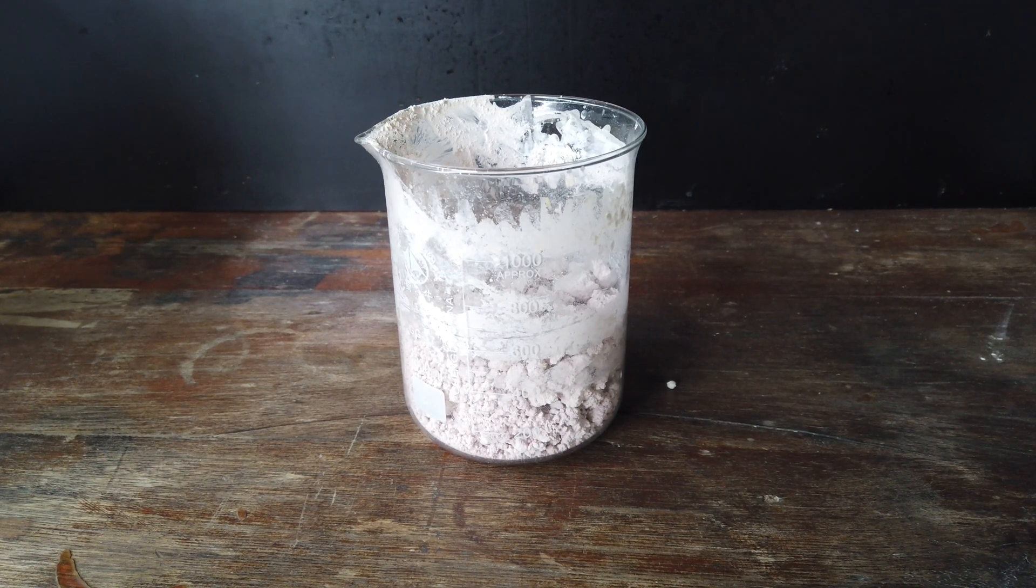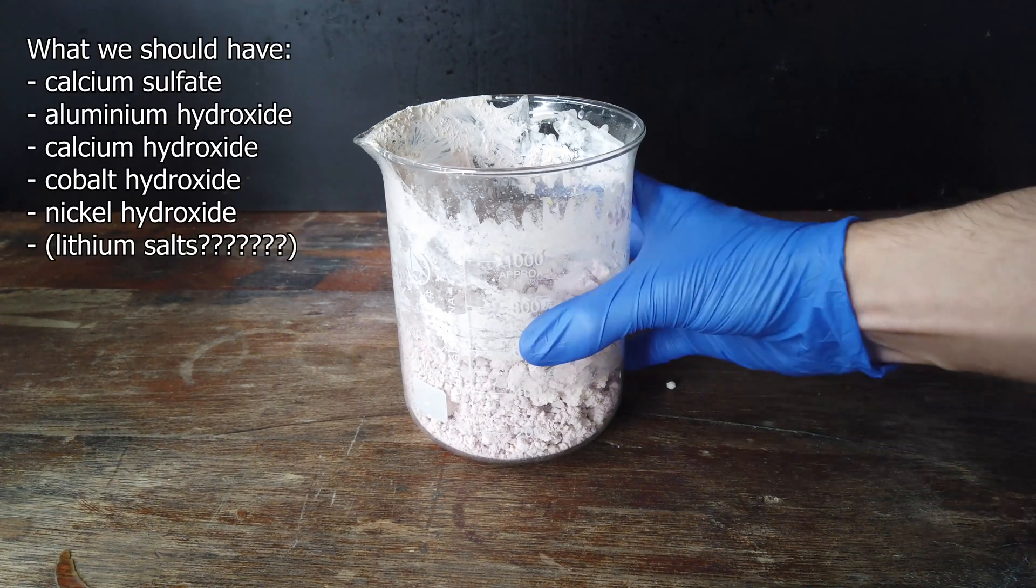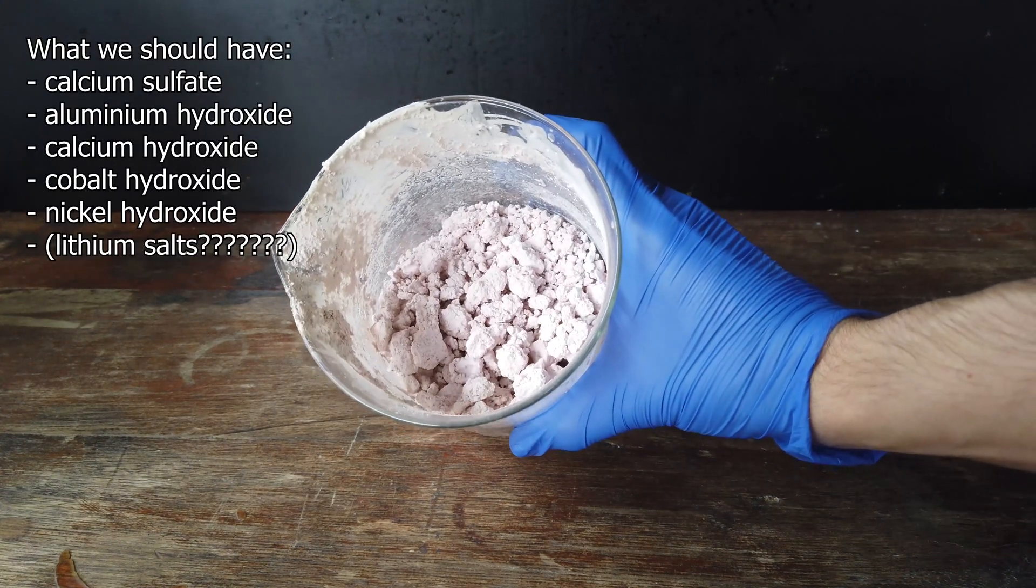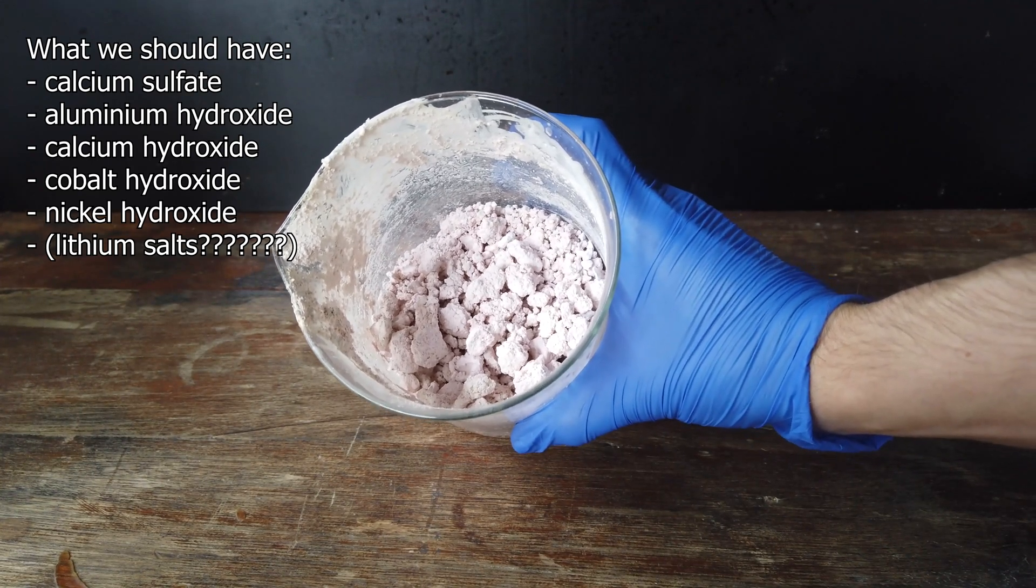This was done by adding calcium hydroxide to solution, which ultimately means that this precipitate here probably contains calcium sulfate, along with hydroxides of aluminium, calcium, cobalt, and nickel.